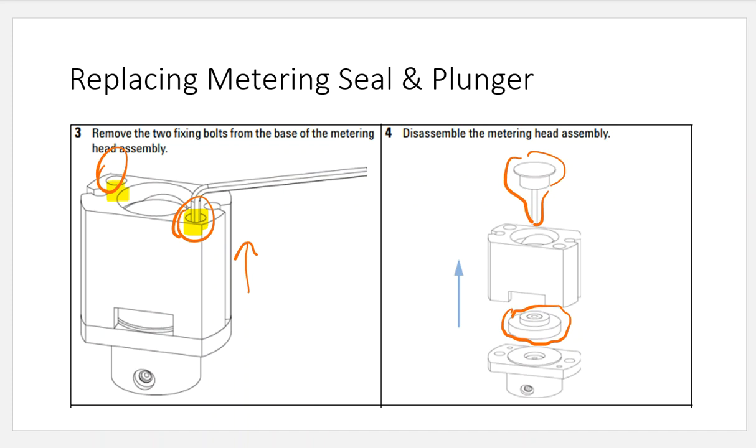So I'm going to inspect those. I'm going to make sure that those look good before I do anything else. Look for damage. Look for wear and tear. Look for dry rot. Make sure that everything looks okay and decent. And then if those look pretty okay, then I'm going to focus on the seal itself.